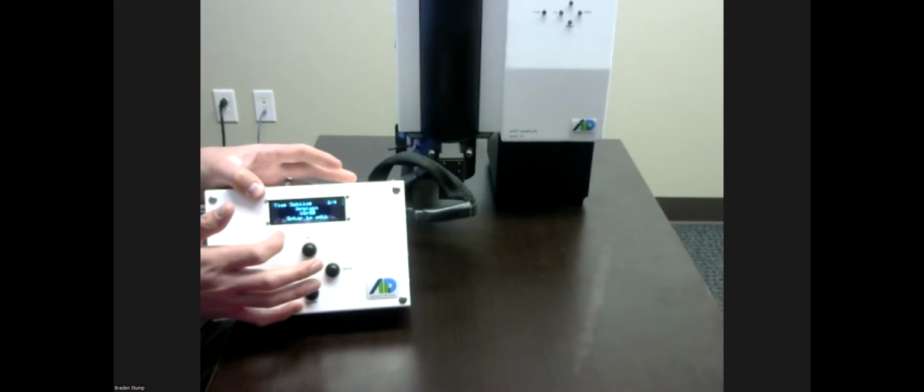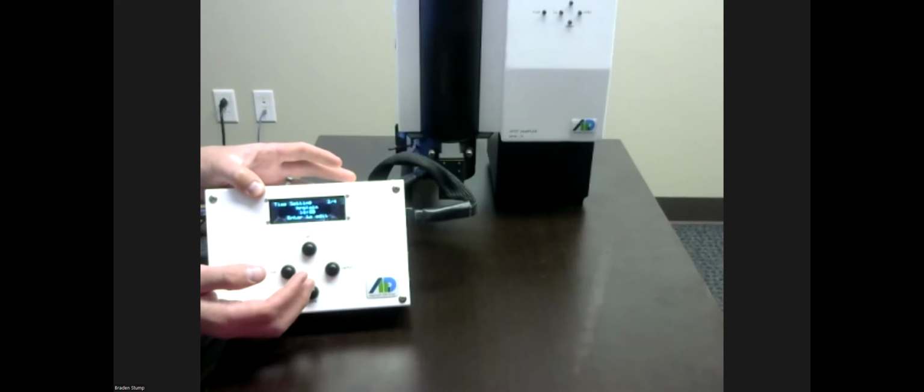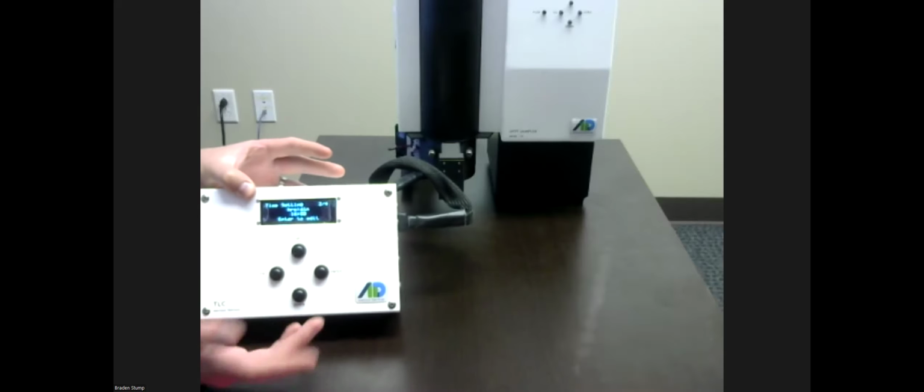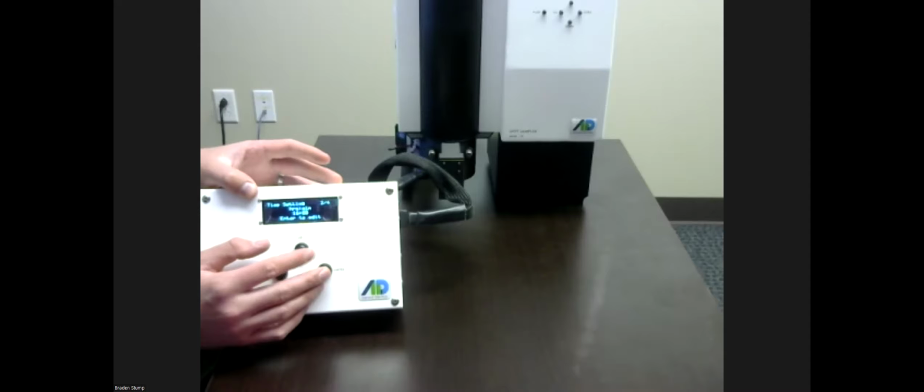I'll just go through all these menus. I'm going to be doing a 16-hour sample. So if I press the up button, we can look at time set in hours and minutes. You can press the enter button to edit that. I won't be editing that today. I'm just keeping it brisk, moving it along for a general review of how things work.